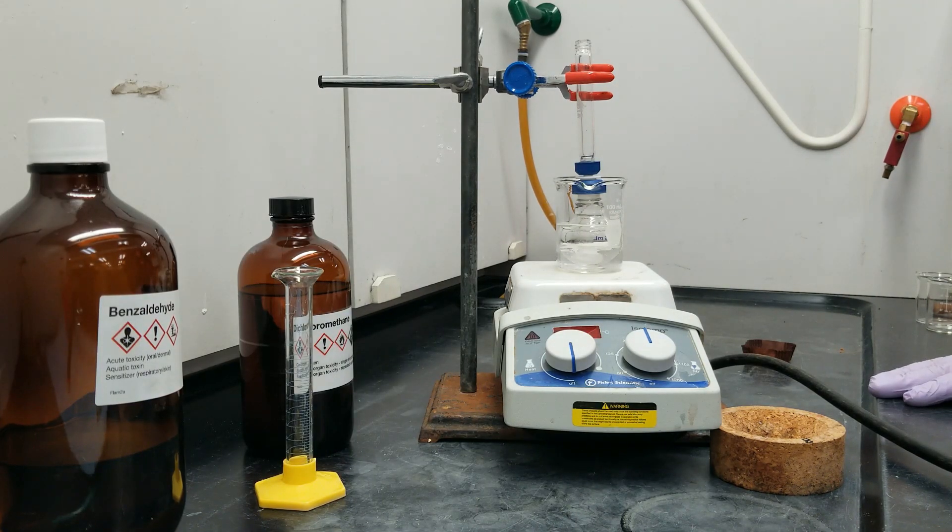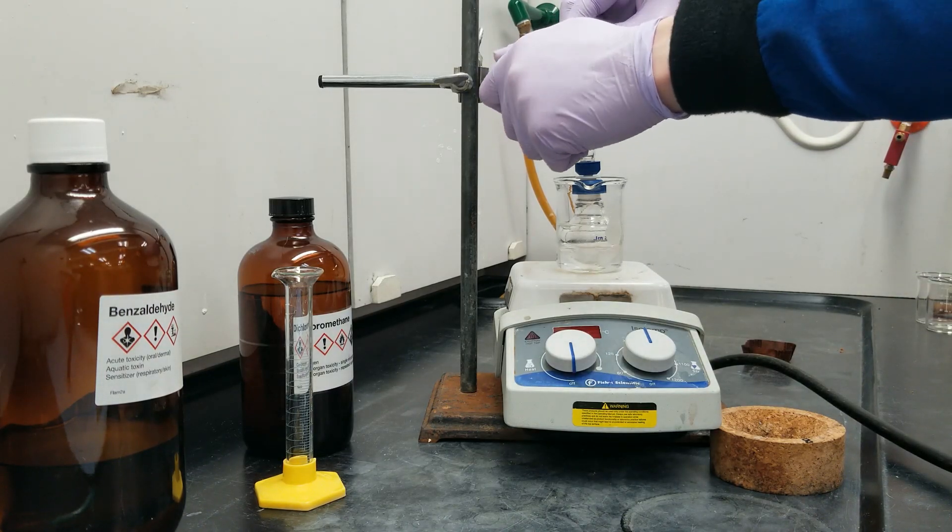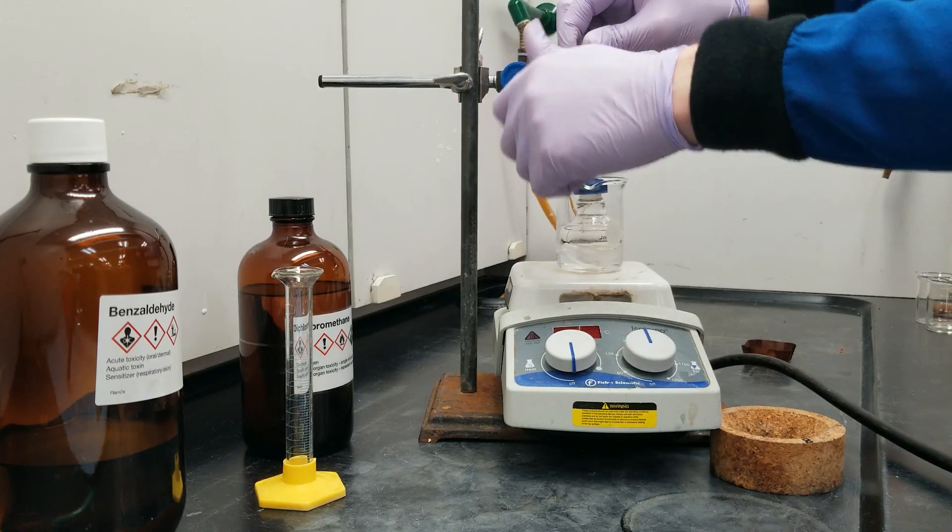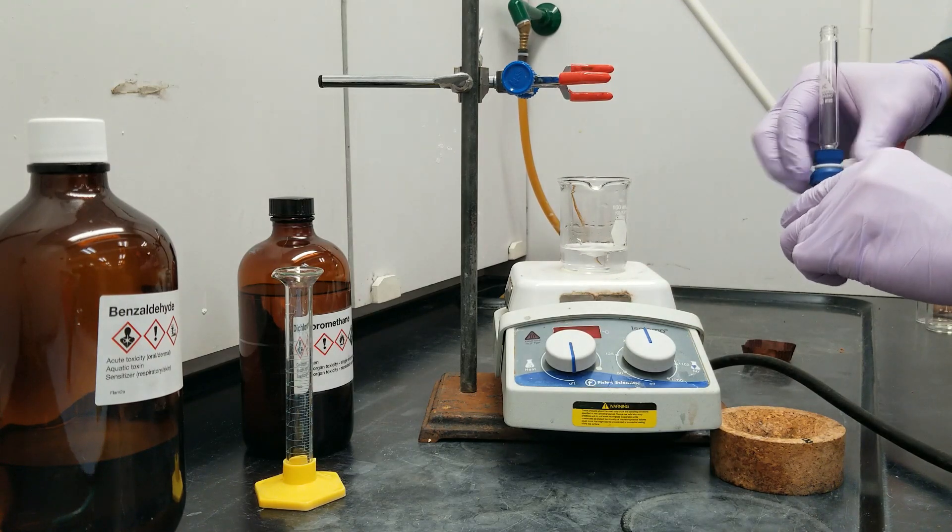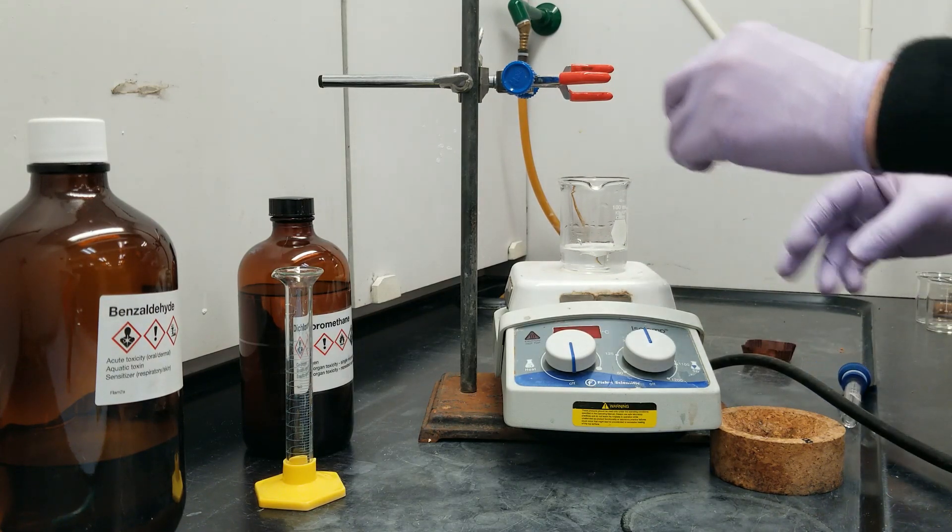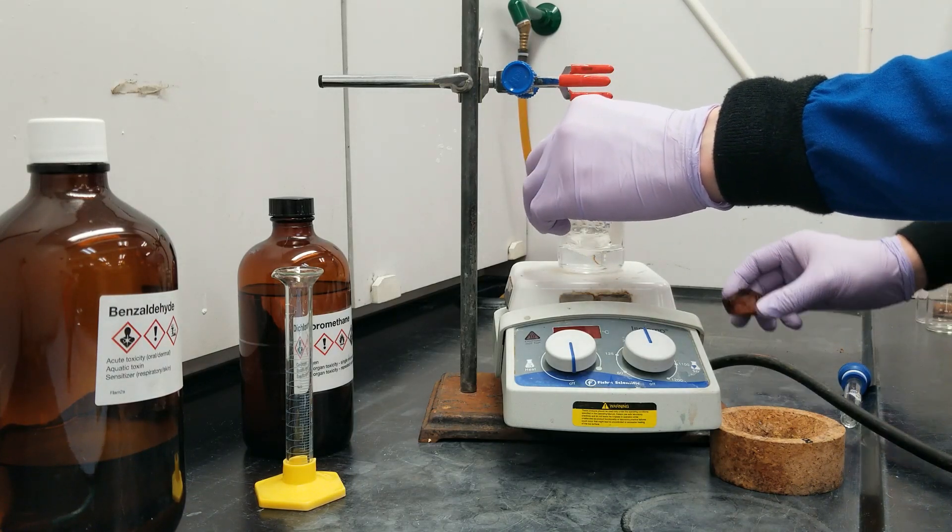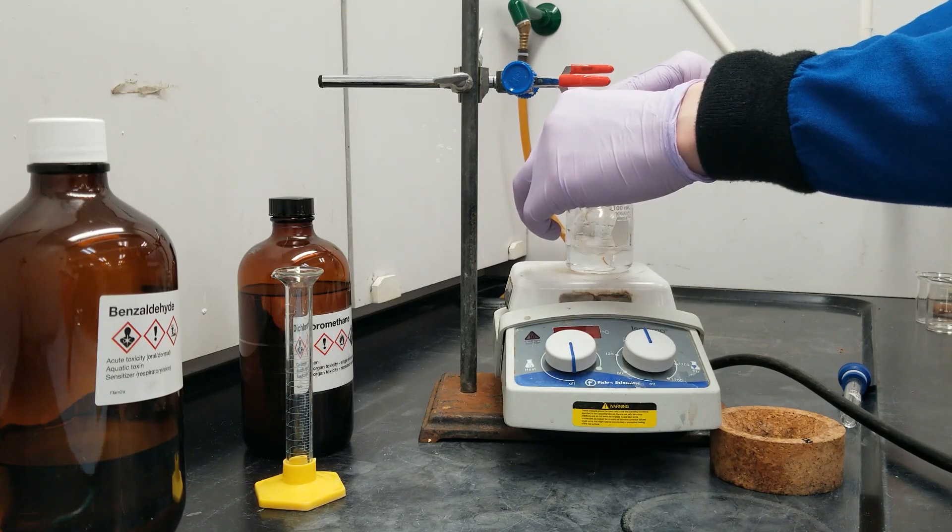So this has been homogenizing on ice for about 10 minutes. I'm going to go ahead and start adding in my Wittig reagent, which means I'm going to take off my clamp here. And while this is stirring and being kept cold, I'm going to slowly start introducing my reagent.